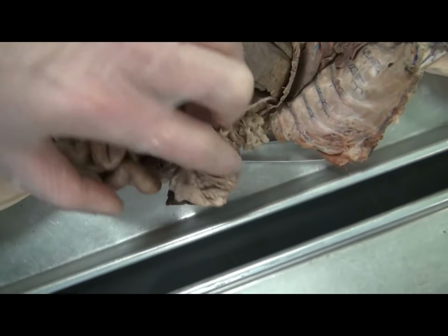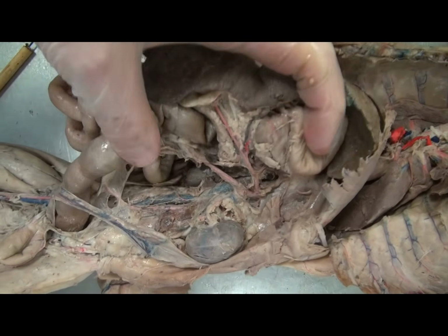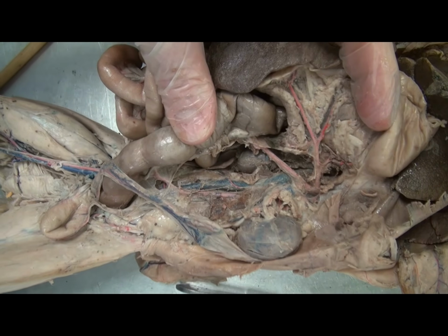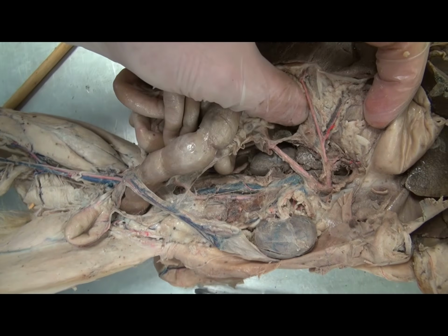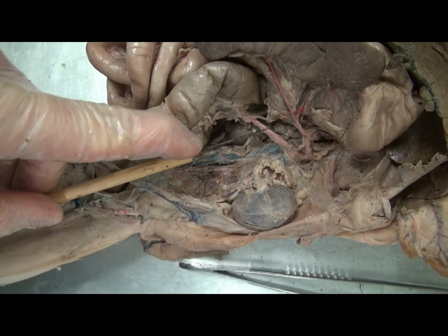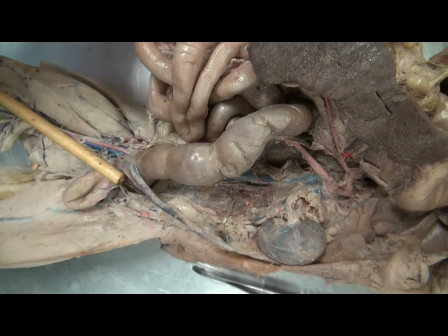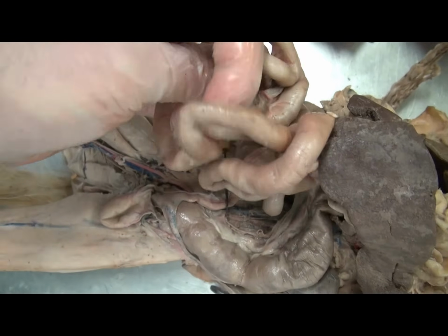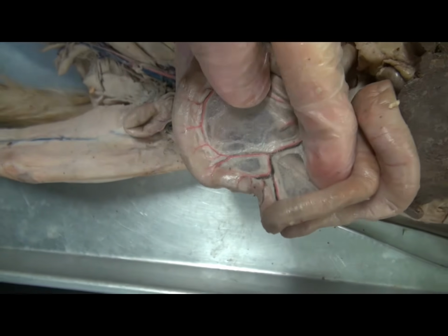In contrast, if you were asked to identify something and you noticed that it was on the left side, this is the best place to identify those unpaired arteries which bring oxygenated blood to the digestive tract. So here we can see two large unpaired arteries. The second, inferior one is known as the superior mesenteric artery, and this is giving rise to the arteries which we see here in the mesentery, servicing the folds of the small intestine there.